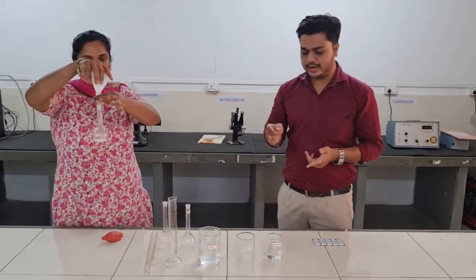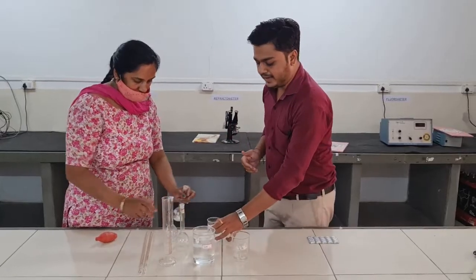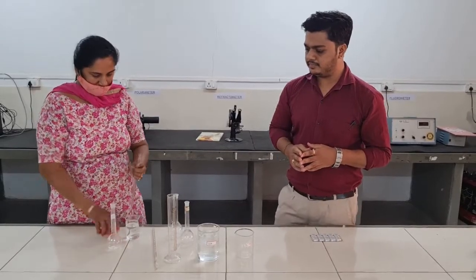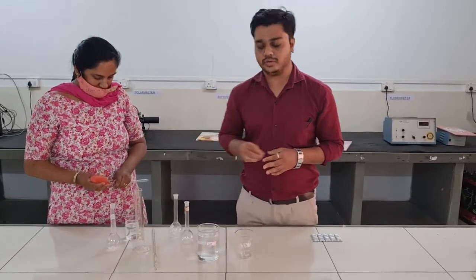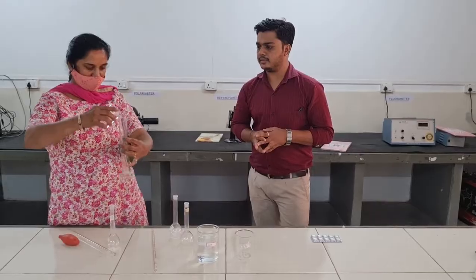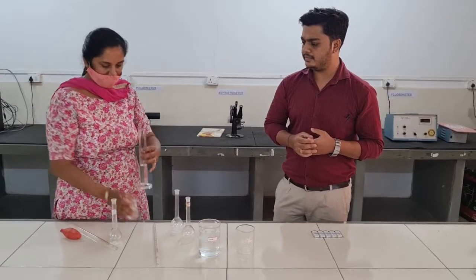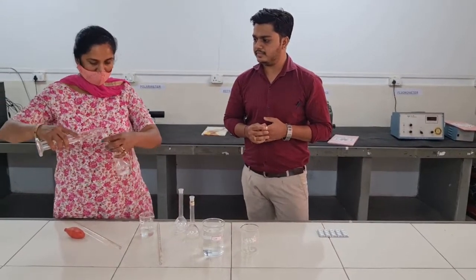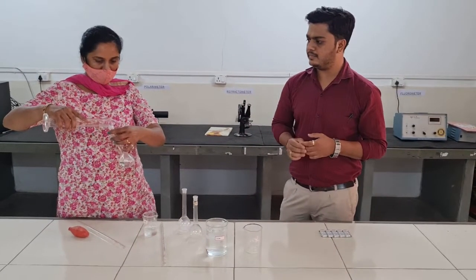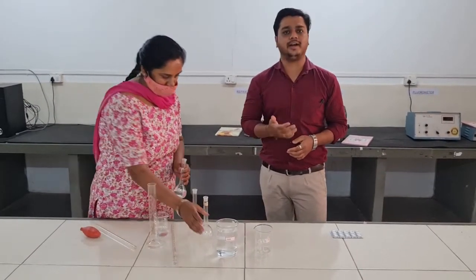The next step is we are going to add 0.1 normal NaOH solution that we have already prepared — that is 50 ml. Now our method is we have to make up the solution up to 100 ml with water.